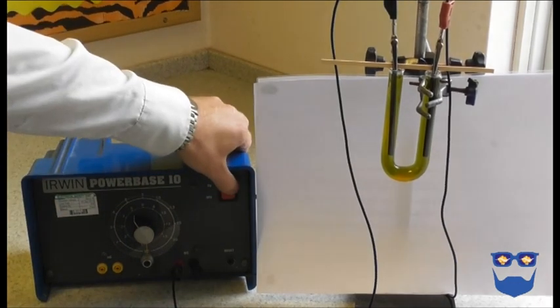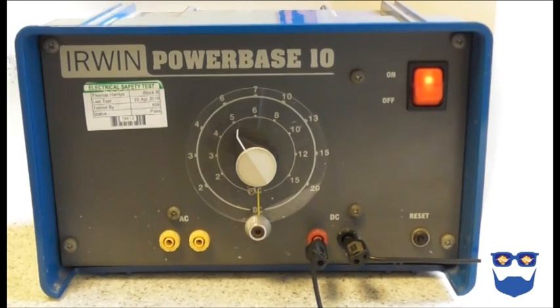Turn the power supply to six volts. Stand back and let the students make their observations.